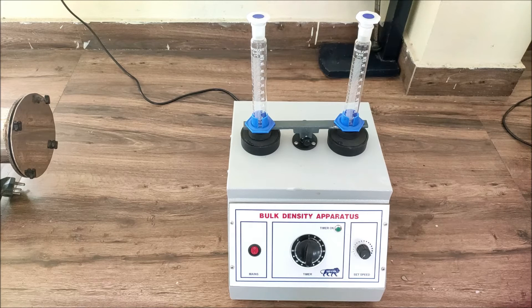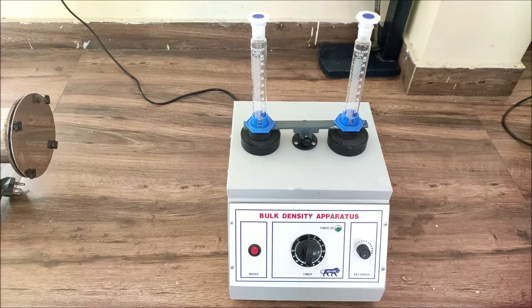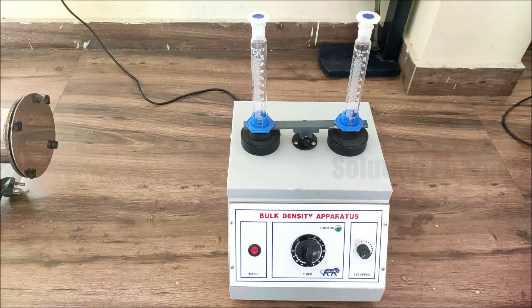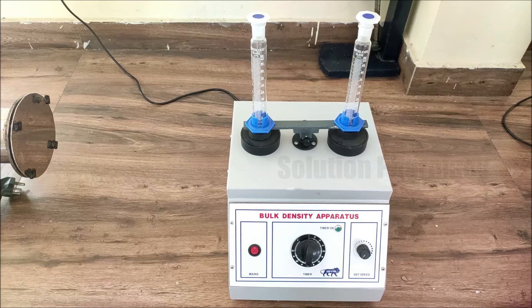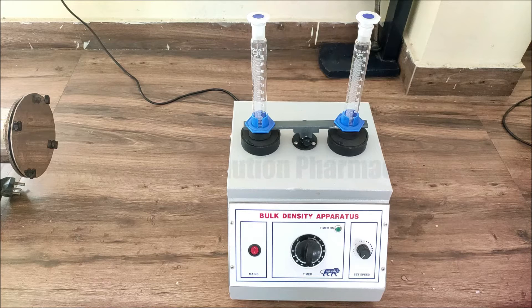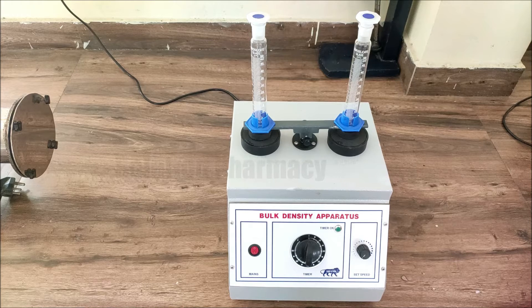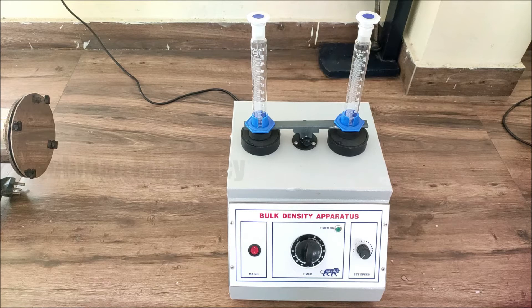Hello friends, welcome to the channel Solution. Today in this video we will demonstrate how we can determine the bulk density of any powder by using a bulk density apparatus — that is, how to operate the bulk density apparatus to determine the bulk density of a given powder.